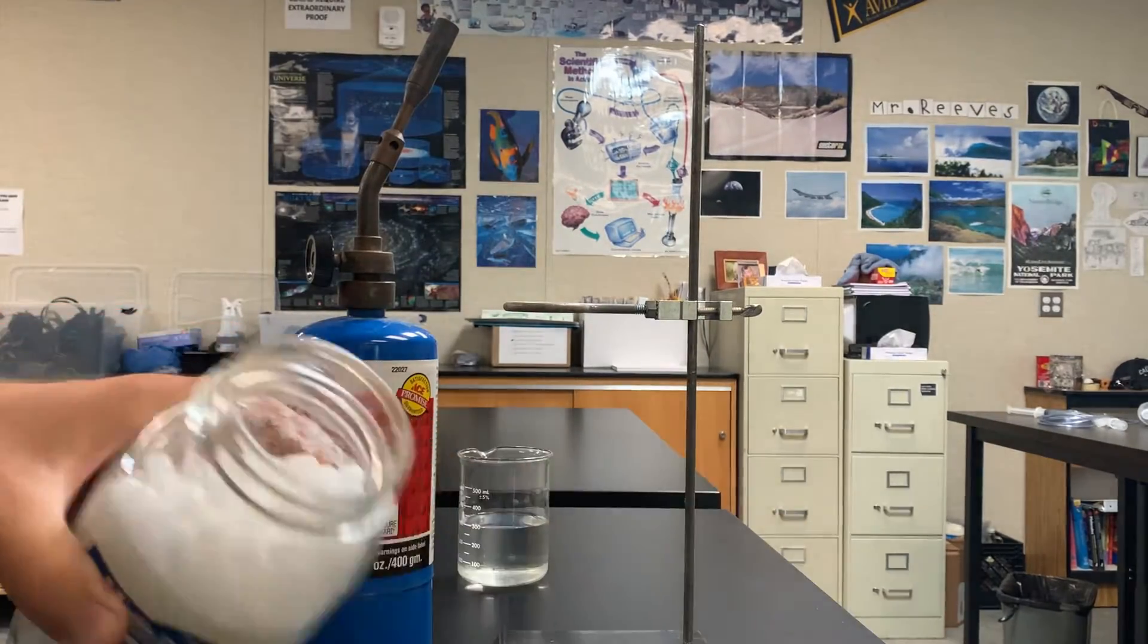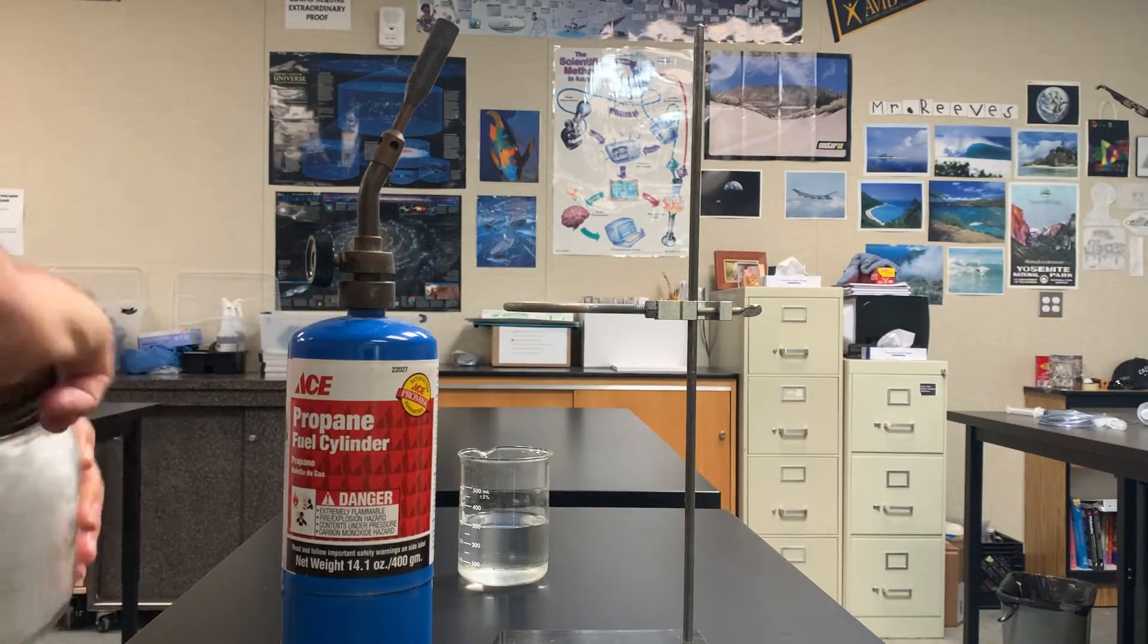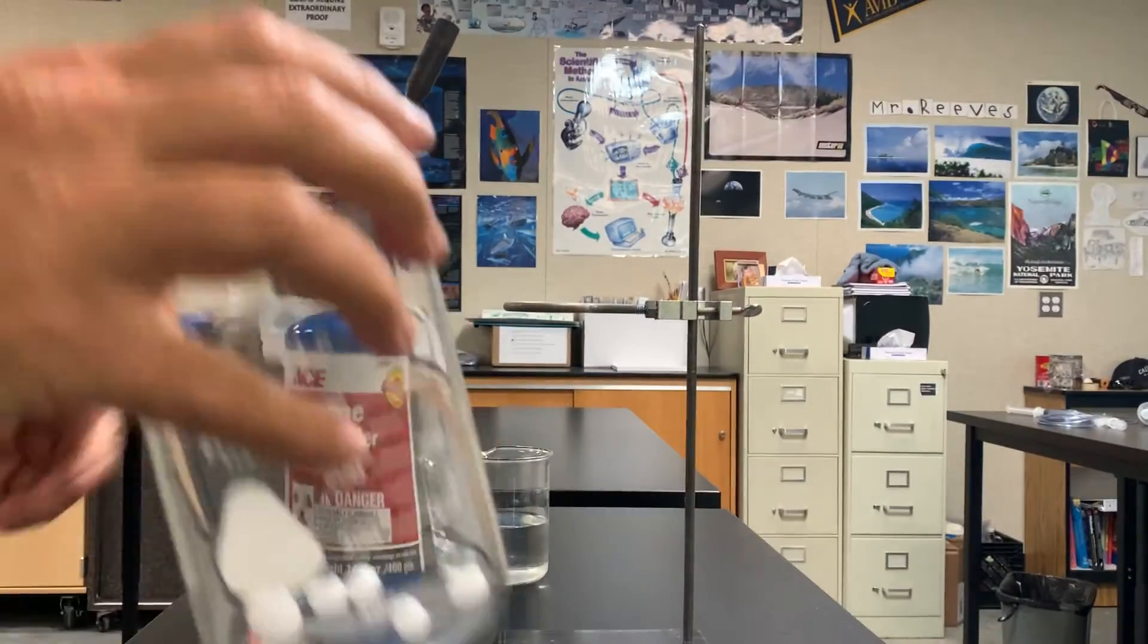Right here. I'm going to show you. I've got some poured out into the beaker.